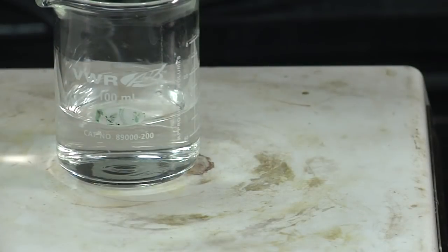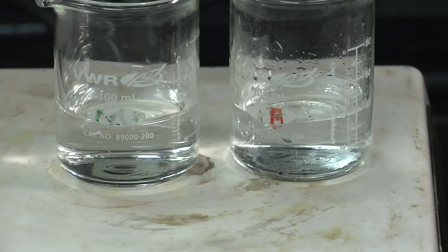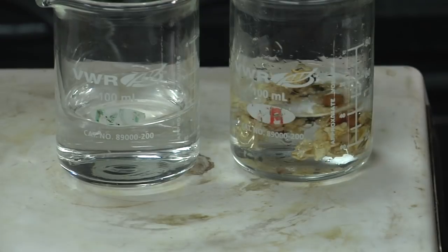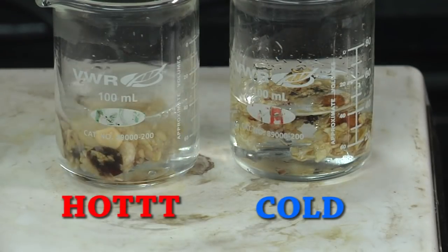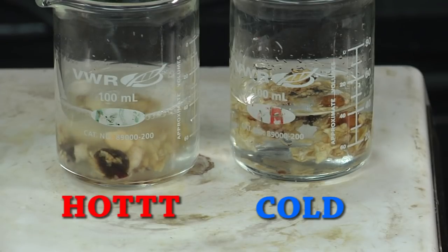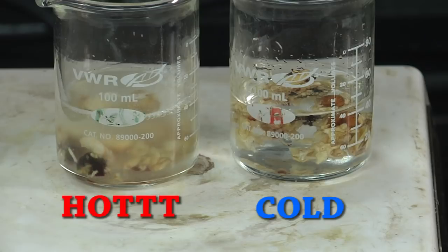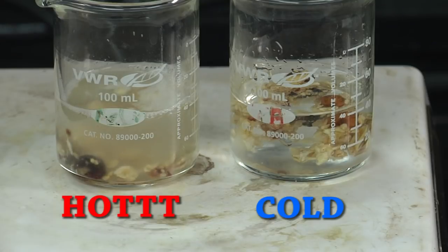Now, in a similar fashion to how concentration affects the dissolution rate, the reaction rate, so too does temperature. You'll see that the granola on the left hand side is being dissolved at a much, much faster rate than the one at the right.